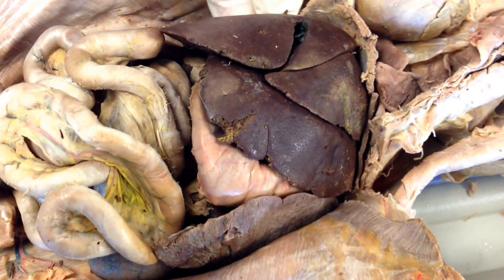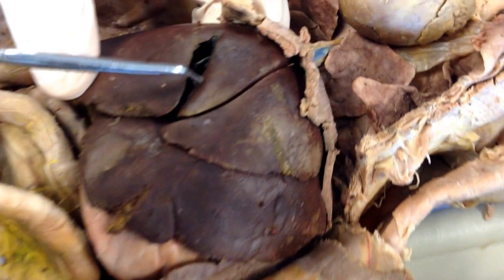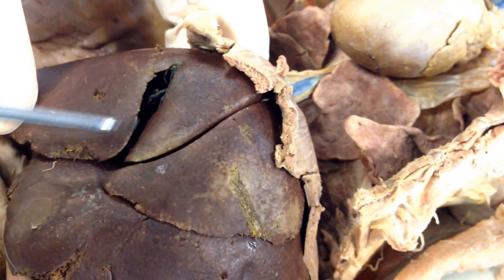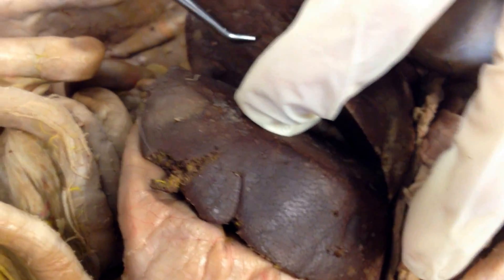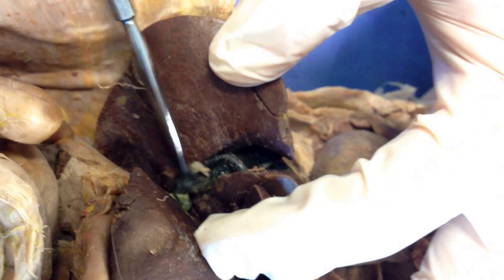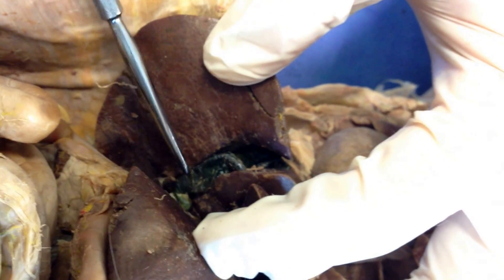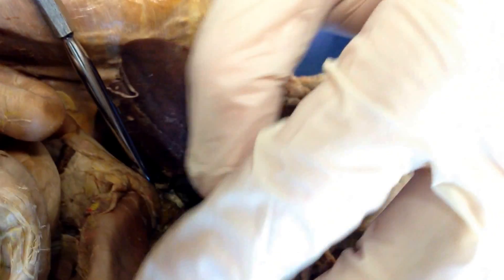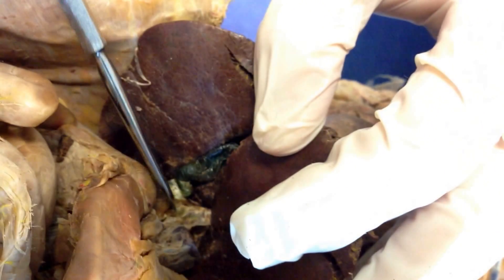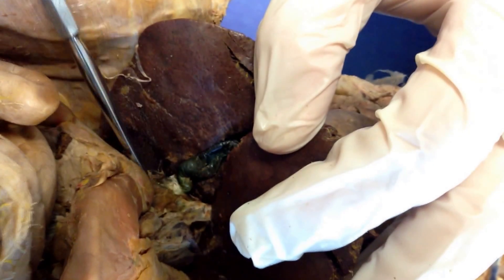Attached to the liver is the gallbladder. Sometimes you can see it on top nicely like this — there's a little hole right here — but sometimes you have to pull apart the lobes to see it. This is more of the gallbladder down in there. The gallbladder has a tube that goes down to the small intestine called the common bile duct, and you can see a little bit of this green tube going down here to the small intestine.